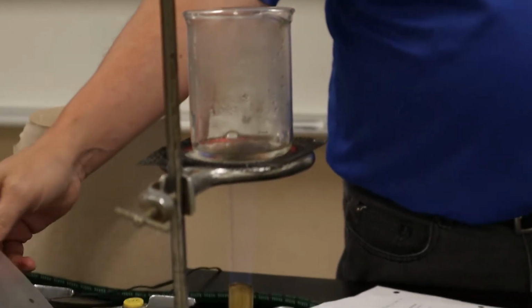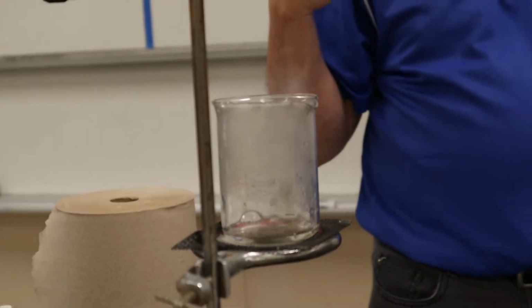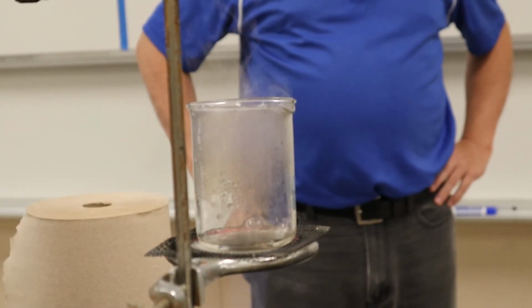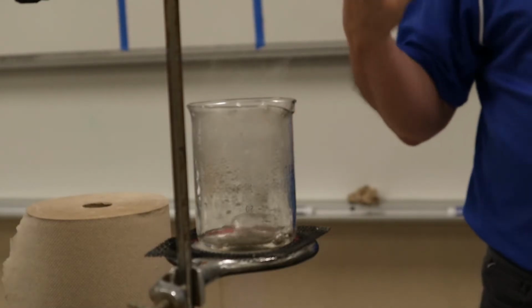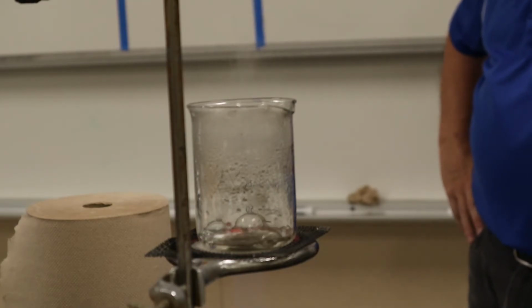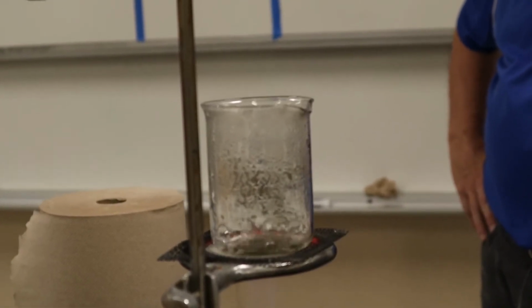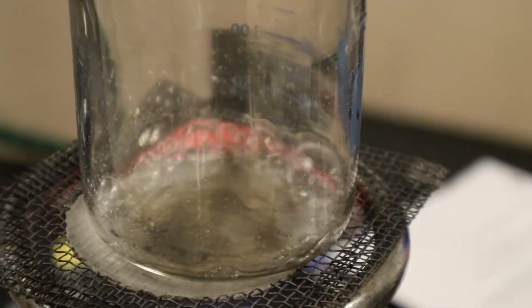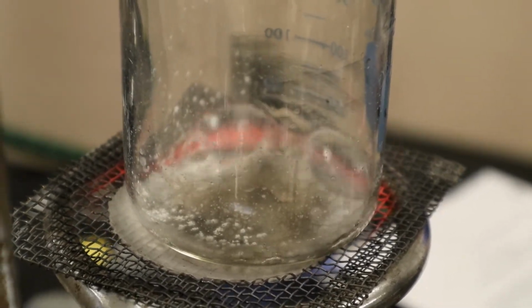All right, so you can see that the water and the excess acid is boiling out of there. So I'm going to stand back because I don't really want to breathe in excess acid. Normally, when we have students do this and there's 10 of these going on in the classroom, we make sure to have the windows open and I've got the fans going. And this is why you always wear your goggles.